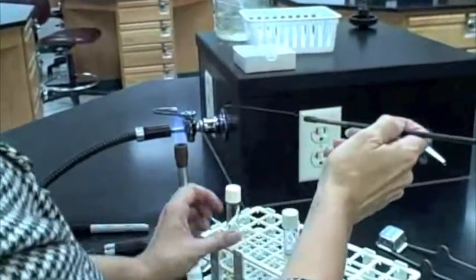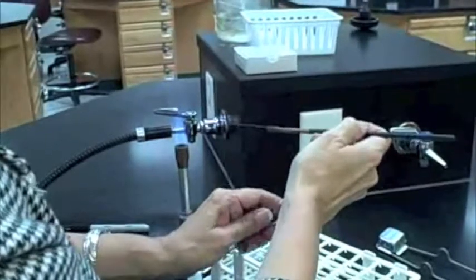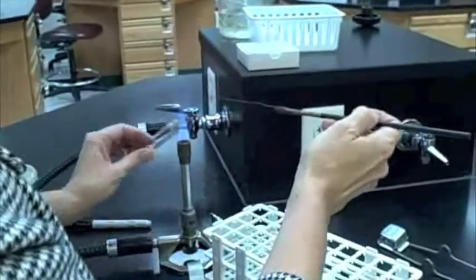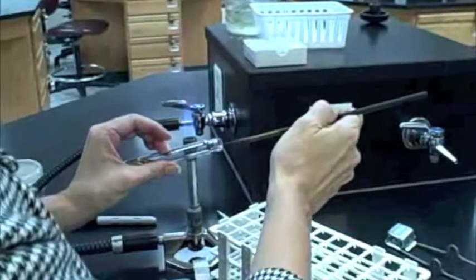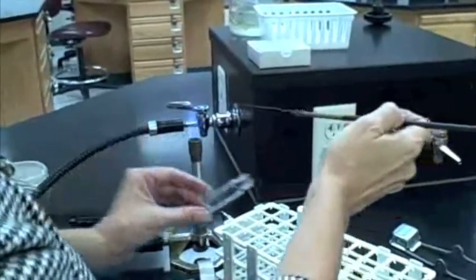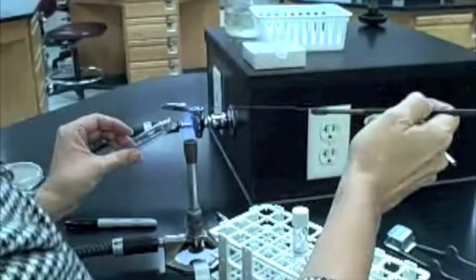Open the sterile media using the same method as you did previously. Flame the top of the tube and hold it at a slant. Hold the loop with the bacteria steady and insert the tube of sterile media up onto the loop.